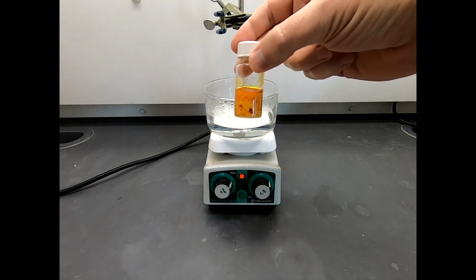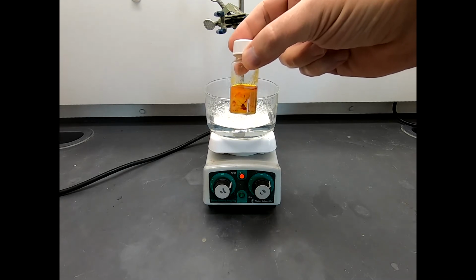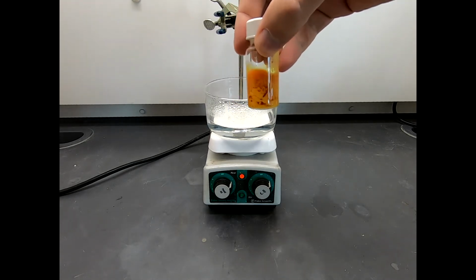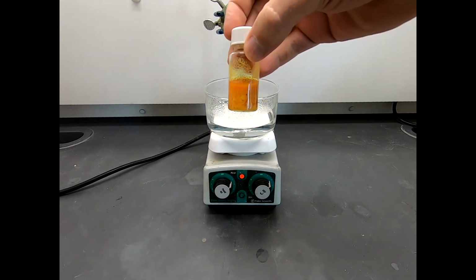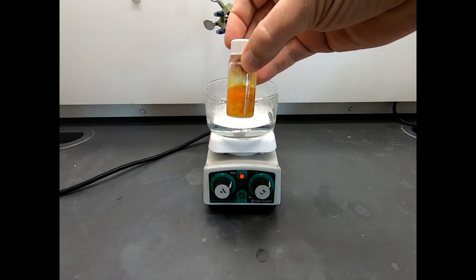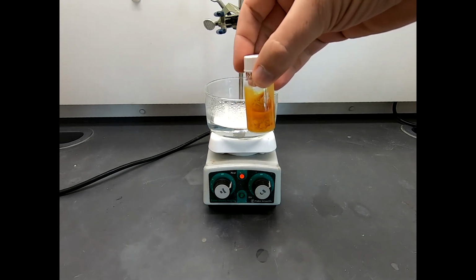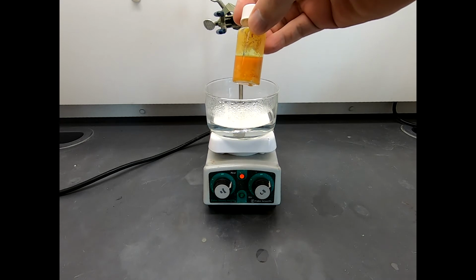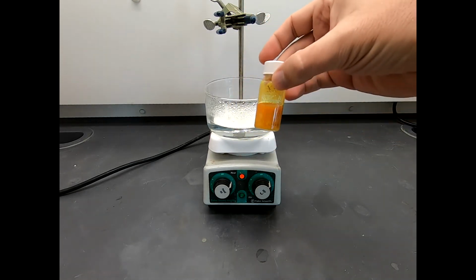I had an old lab mate who would say color changes and precipitates are almost always a good sign in a reaction. I don't know if it's universally true, but it's a sign that something's happened. And if you designed your experiment to do what you want, then something happening probably means a good thing. So yes, color changes and precipitates are always exciting, and this definitely has a precipitate.